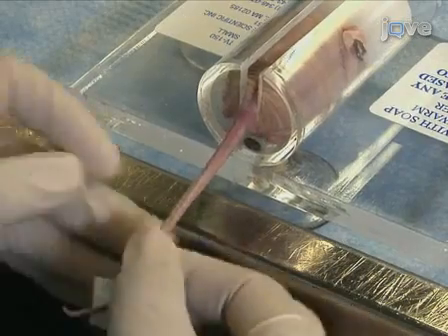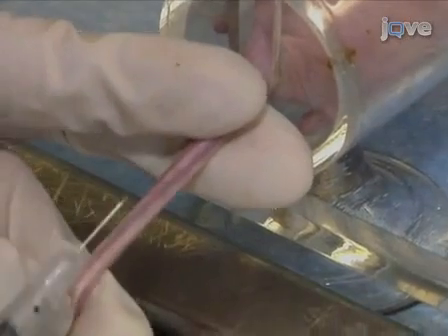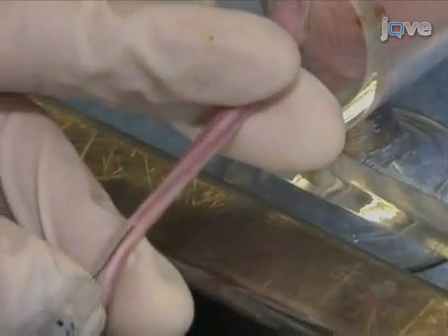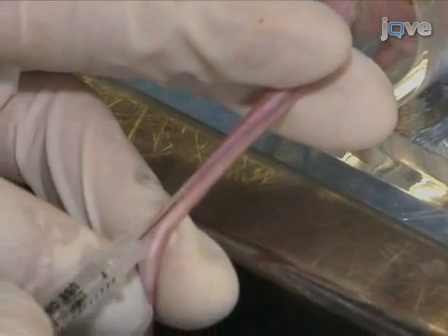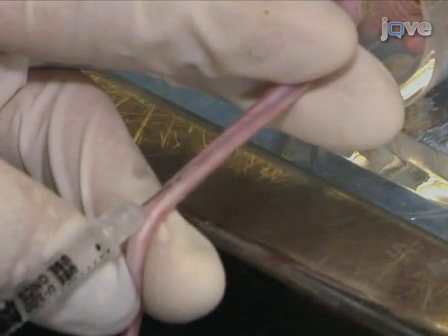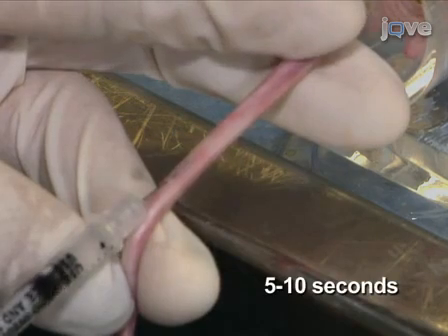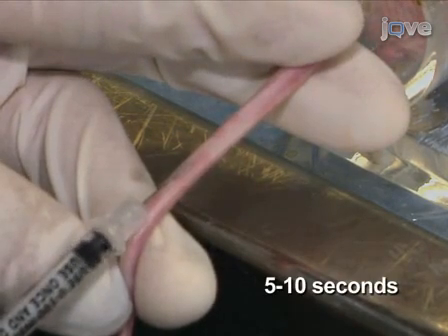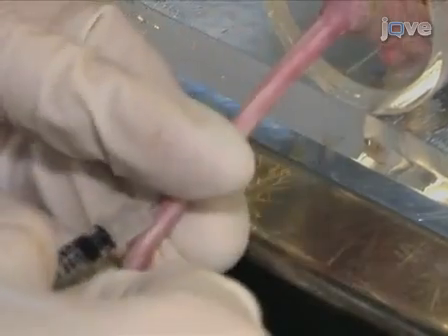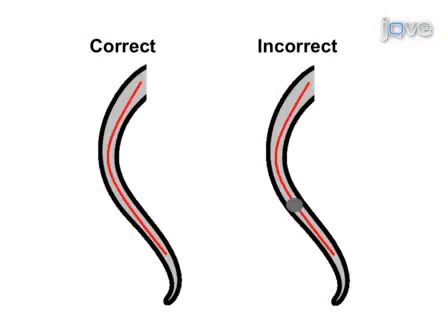Clean the injection site with an alcohol swab. Next, insert the prepared syringe, bevel side up, into the vein. If the needle is properly placed in the vein, it should move freely and without pressure. Slowly inject the drug, with even pressure, over 5 to 10 seconds. If the tail becomes swollen, stop injecting, as this indicates that the needle is no longer in the vein.